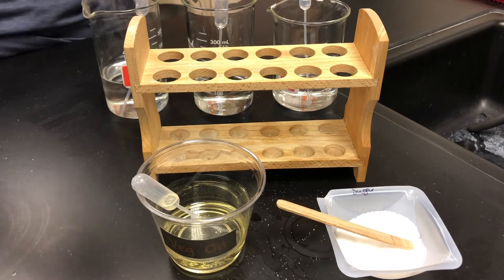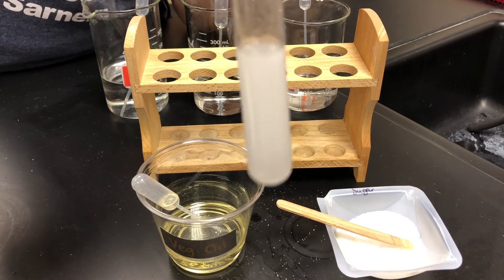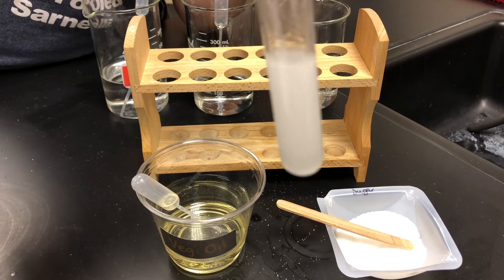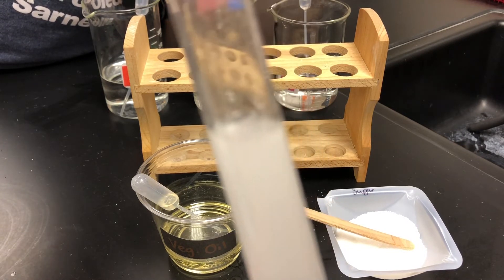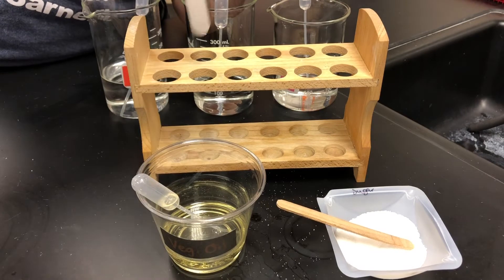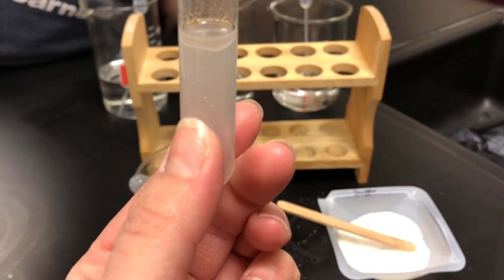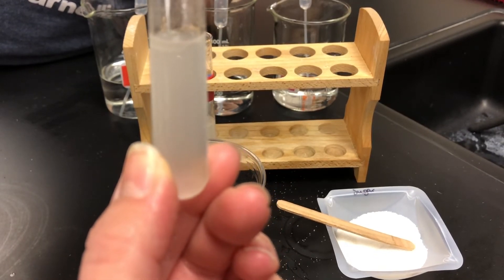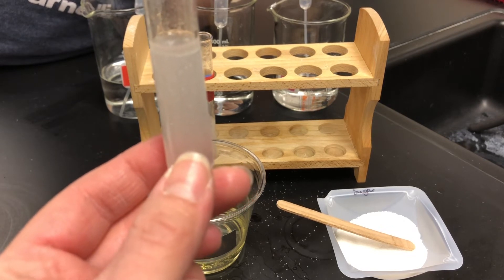We are ready to observe our results of our oil solubility. Looking at our first test tube, we can see that the oil has not mixed with the liquid. It appears cloudy, which indicates that oil is not soluble. You can see that there are oil bubbles floating around inside of the liquid. Now looking at test tube number two, the same results — you can see that the oil droplets are still present inside and are still suspended in the liquid.